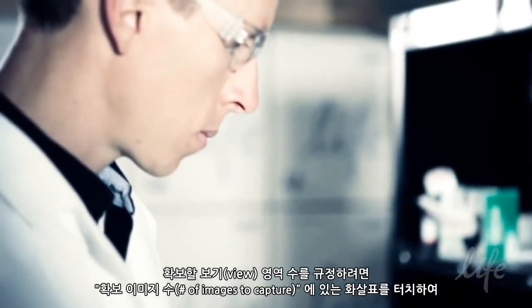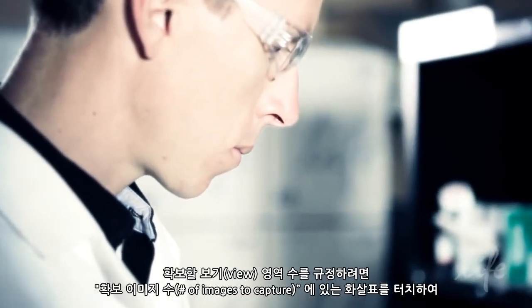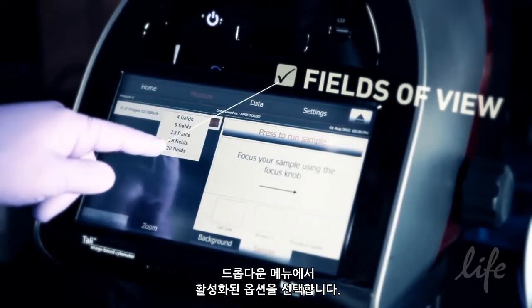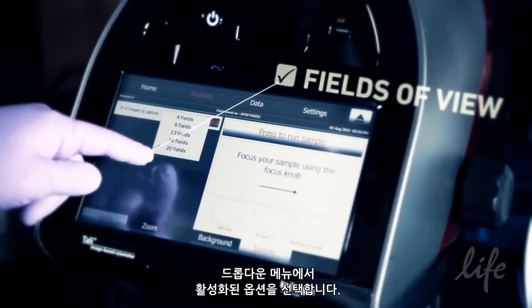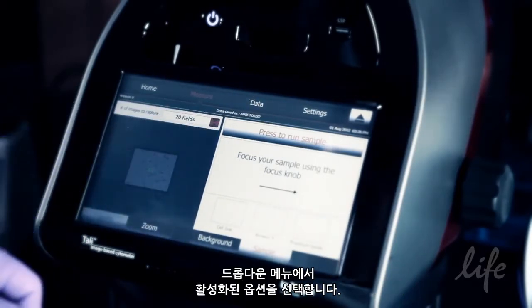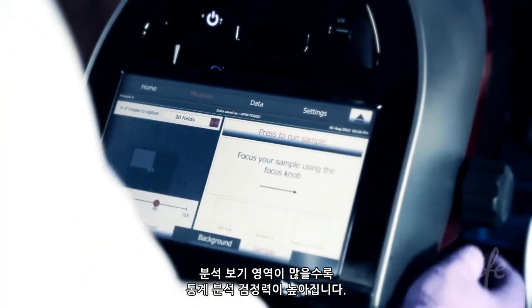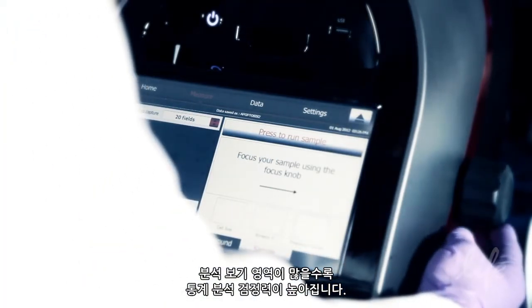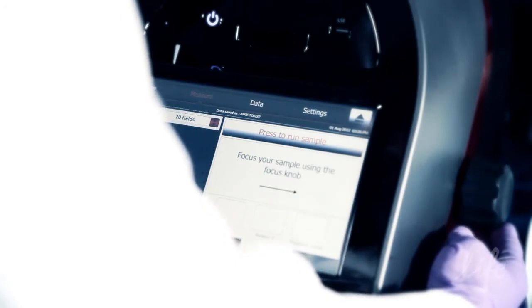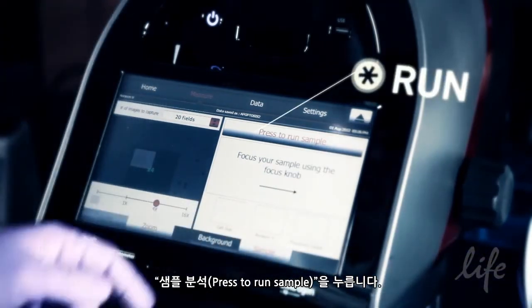To specify the number of fields of view to capture, touch the arrow button on the number of images to capture drop-down menu and select from the available options. The more fields of view analysed, the more powerful the statistical analysis. Touch press to run sample.